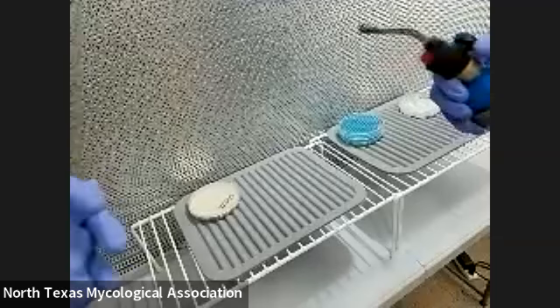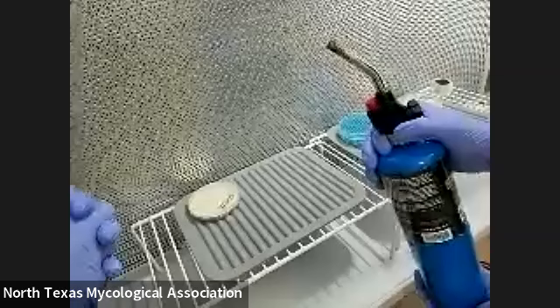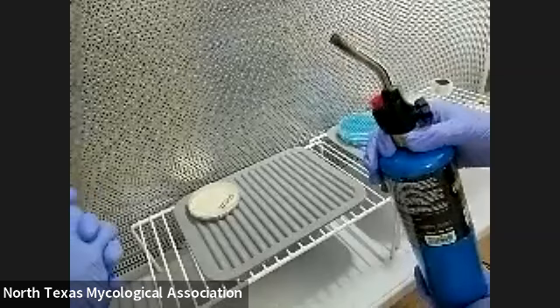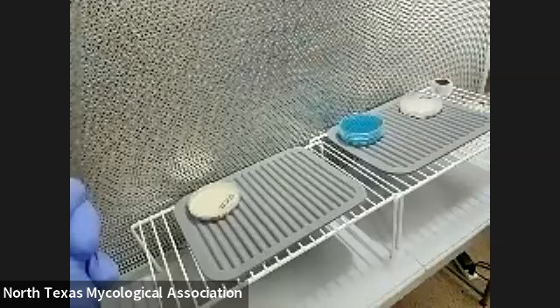I also have this little torch just to sterilize the scalpel whenever you take transfers, because it has to be sterile. I'm going to bring this to the class. I guess we don't have Bunsen burners.